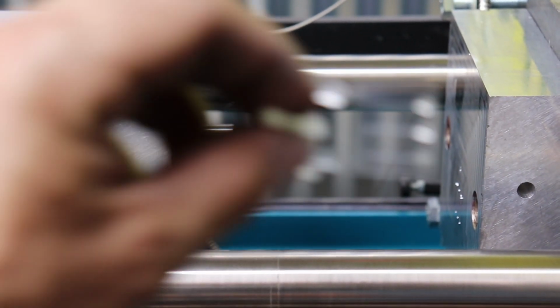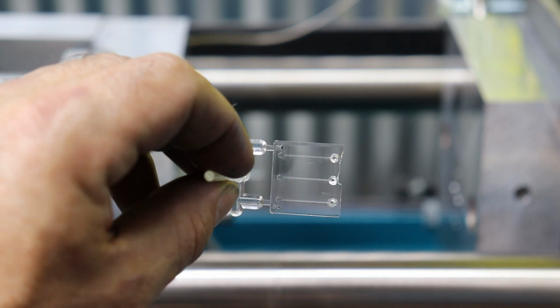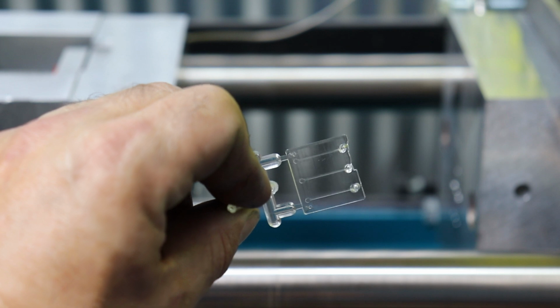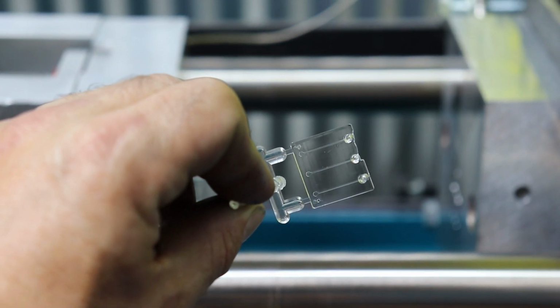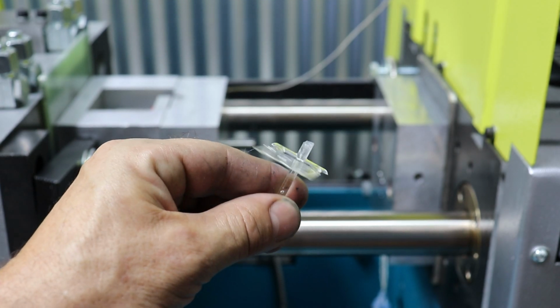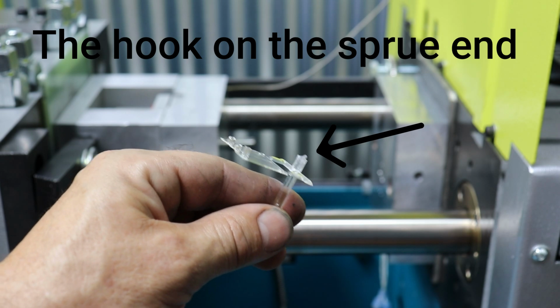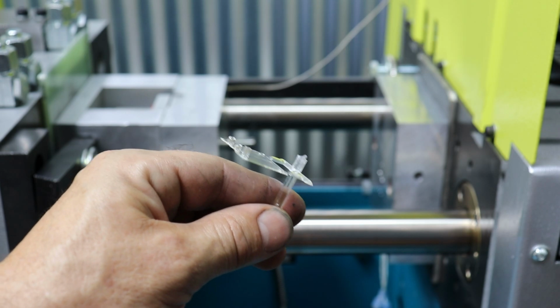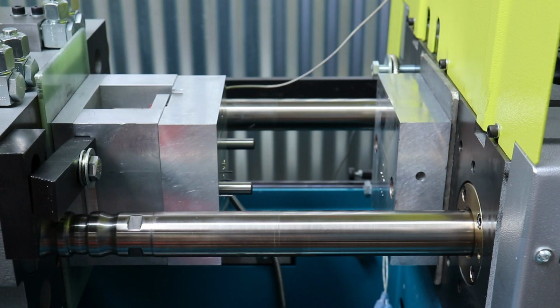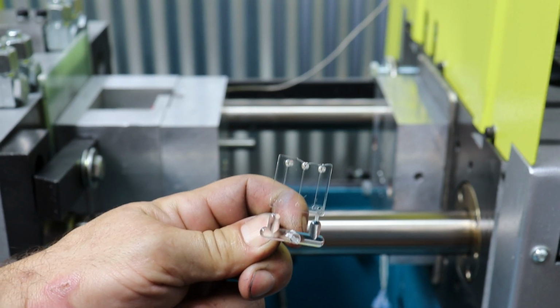Anyway, but the other part I was telling you about, you can see how it's not completely defined on the back. So I probably need to increase injection pressure or something. There you go. You can see on the back there's kind of like this hook. I think that hook is starting to work. And the part is not fully defined either. It's kind of hard to focus here. I may have to go in the microscope and show you. But you can see how there is basically a ragged edge there.